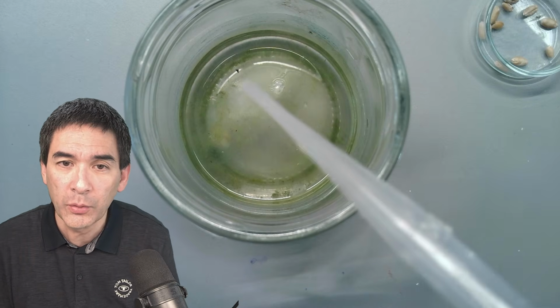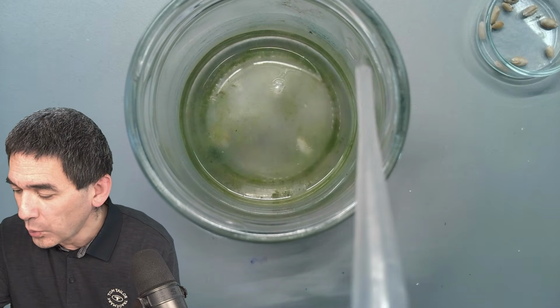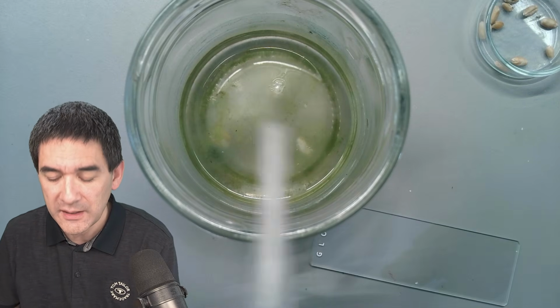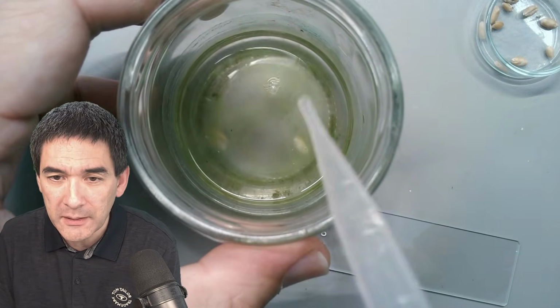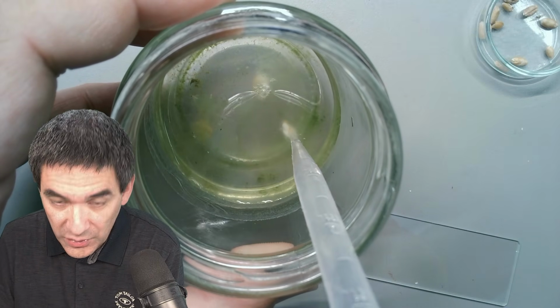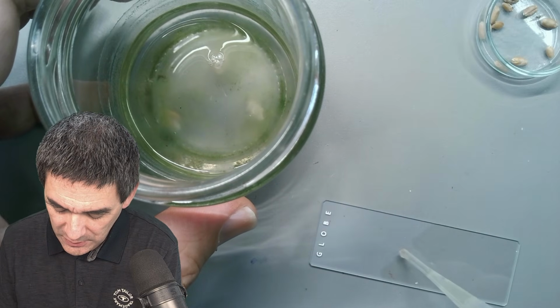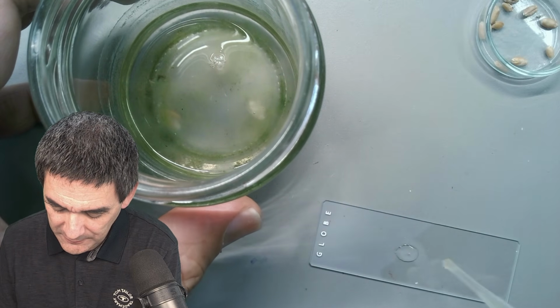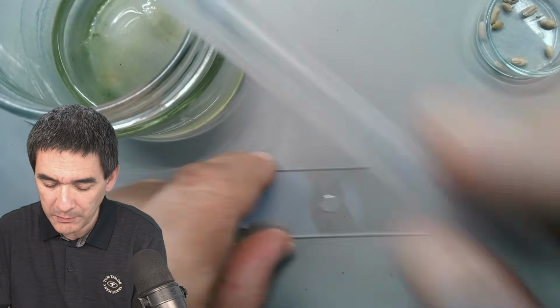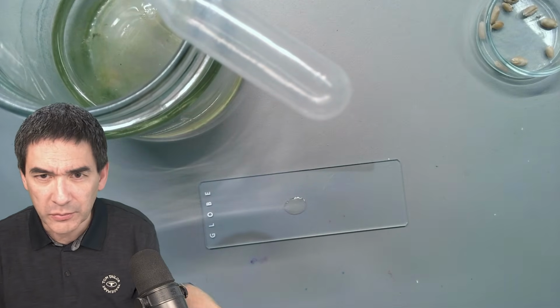And we're now going to put this under the microscope. I'm going to show you two ways of how you can do that. The first way is you simply take a pipette and you go all the way down to the grain and suck up a small amount. You put that here on the microscope slide, then put a cover glass on top, and we'll show you what the problem with that is, because you're going to say, why is this a problem, right?